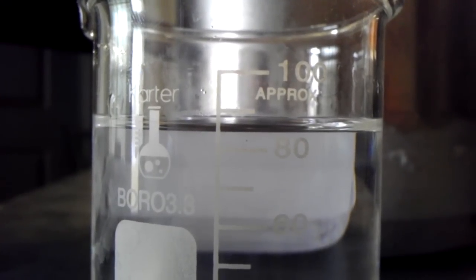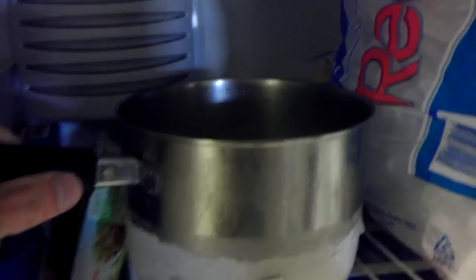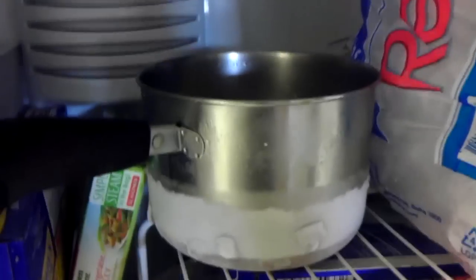What I want to do is measure 90 milliliters of acetone. Put the acetone in the freezer, and wait for about half an hour until it cools down.